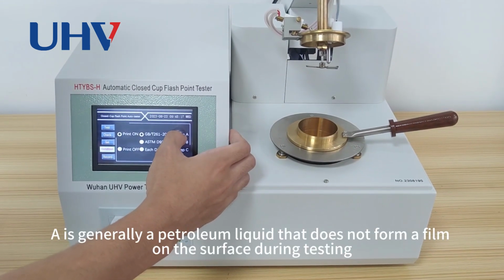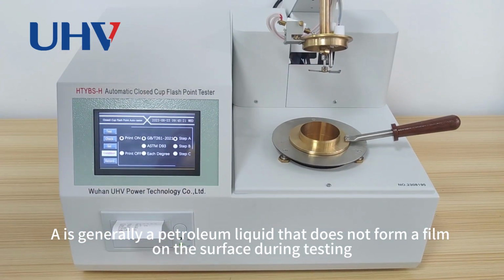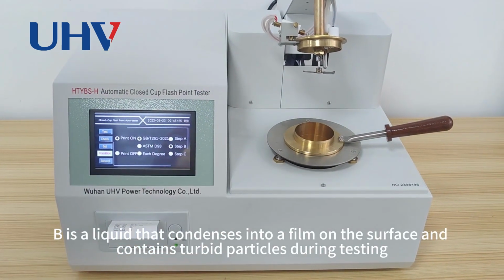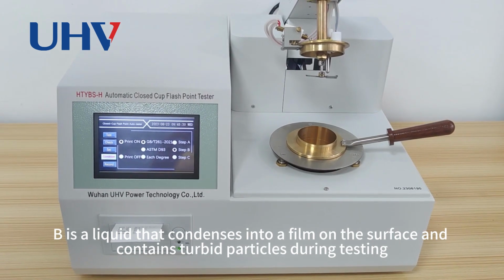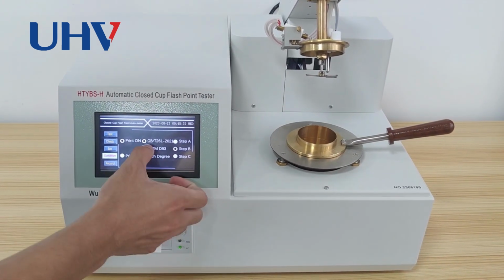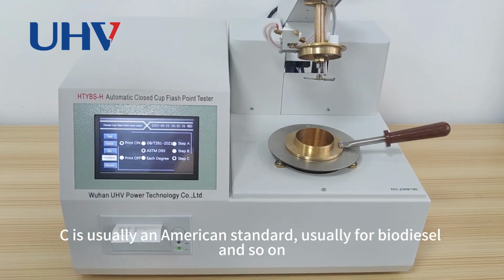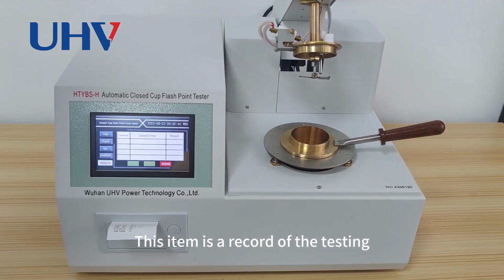A is generally a petroleum liquid that does not form a film on the surface during the testing. B is a liquid that condenses into a film on the surface and contains turbid particles during testing. C is usually an American standard, usually for biodiesel and so on. This item is a record of the testing.